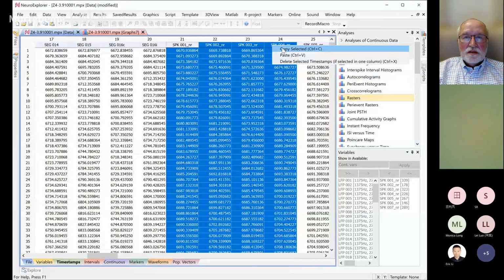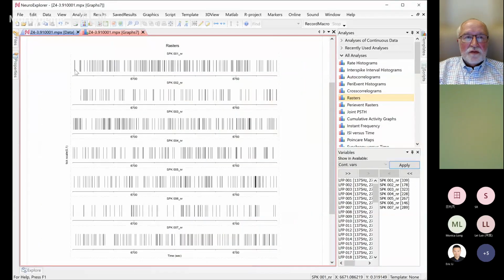Inside Excel. Okay. And can this software calculate the interval between the rasters, like from first to last within this? Not currently. You may do this in a short script, but it's not available as a menu option. Okay.